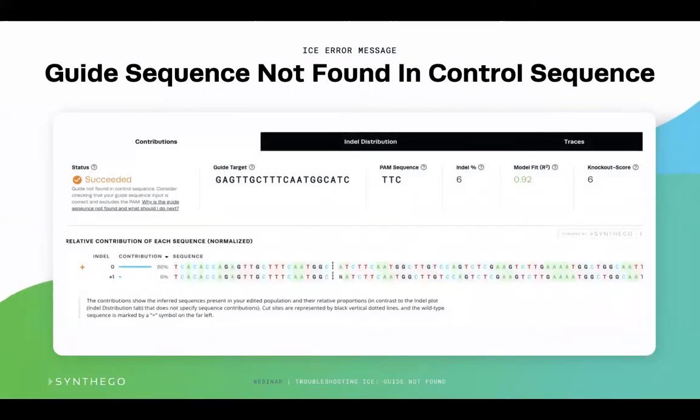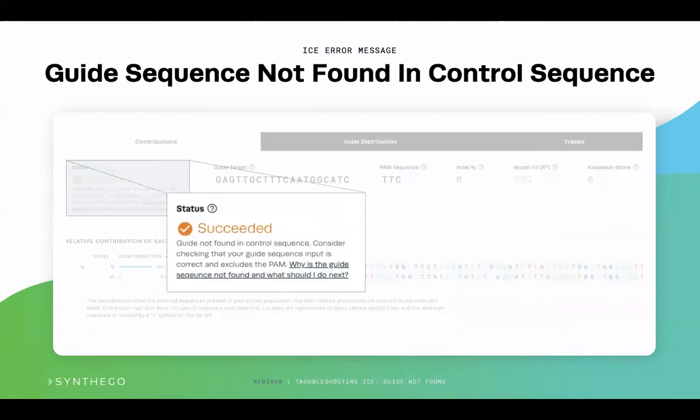Here you can see one common ICE error message stating the guide not found in control sequence. You should also note the ICE status says succeeded in orange, indicating that there was some parameter ICE was having a difficult time interpreting from the uploaded information it received. In this instance, ICE gives you advice on how to correct the troubling results by stating the guide is not found in the control sequence. It is recommended to check the guide sequence that was input into ICE and to exclude the PAM sequence.